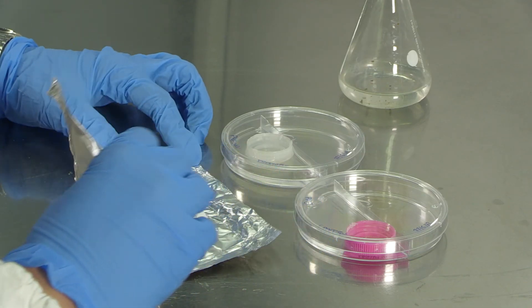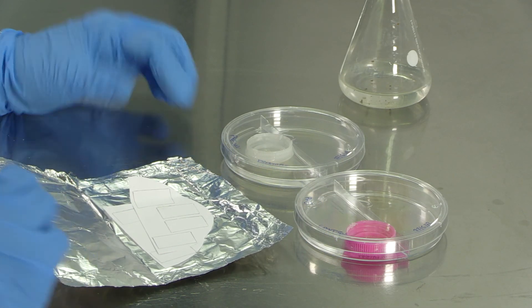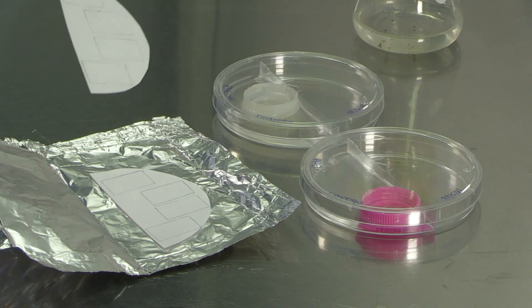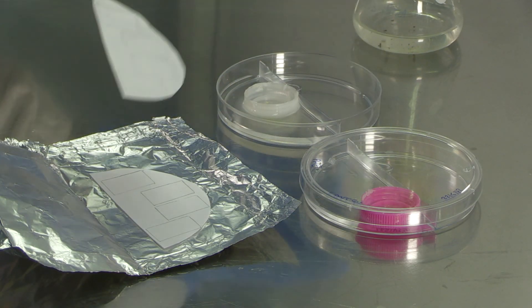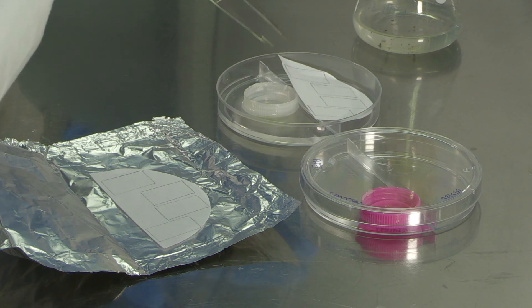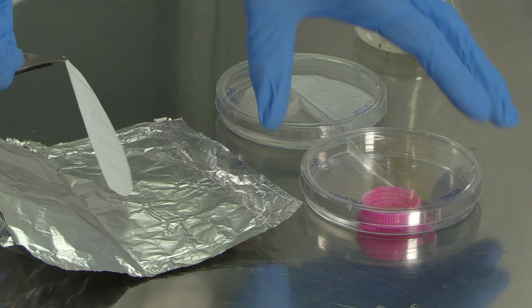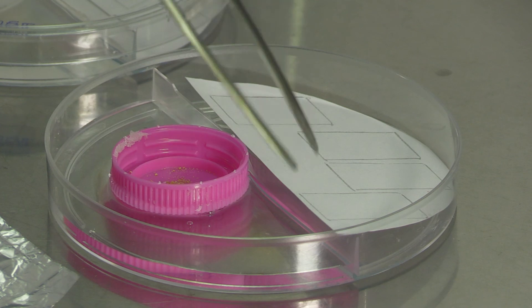Being organic material, paper is susceptible to fungal attack and was selected as target material for this experiment. Sterilized paper samples must be placed in the upper sector of each petri dish.